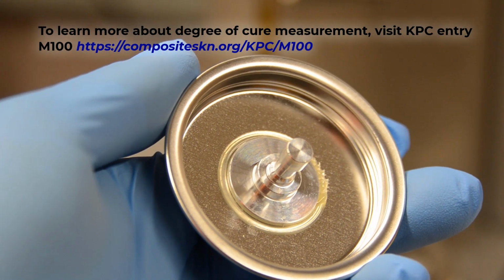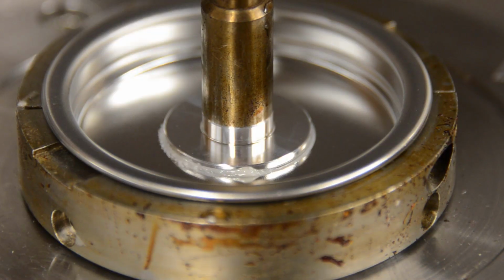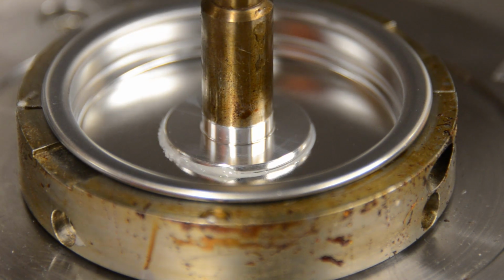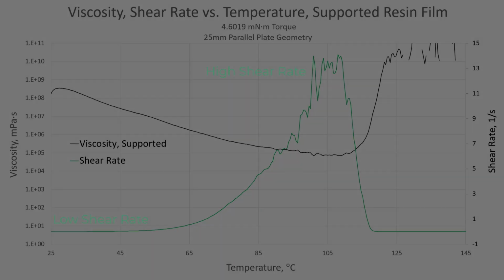The manufacturer also does not list the exact method that they use to measure viscosity. The shear rates that produced our measurements may have been higher or lower than those used in the manufacturer's tests. Processes involving film adhesives would likely involve lower shear rates than those present during some portions of our test, and limiting the shear rate to a lower value may produce a different result if our resin is non-Newtonian.